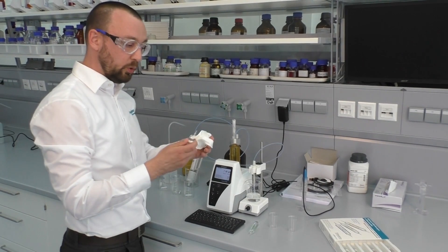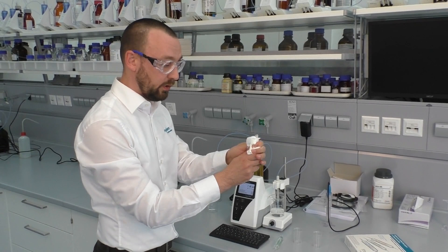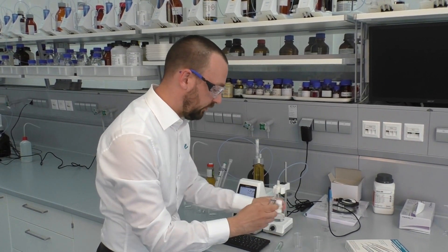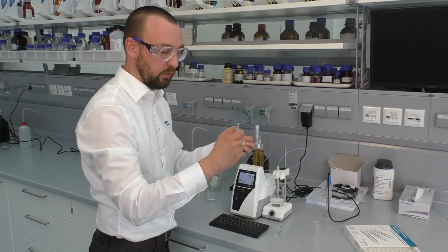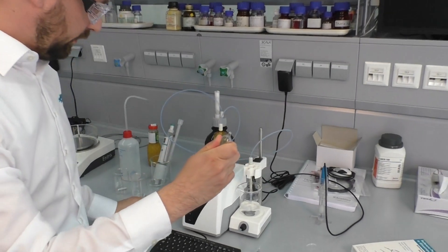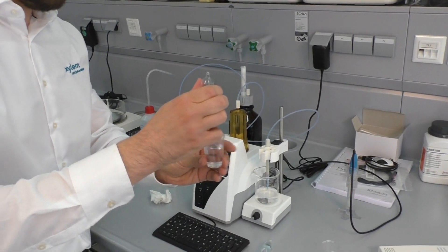To open the buffer solutions we are breaking the necks on both sides. First side — then we can pour the solution into the beaker. Then we break the second neck and the buffer solution flows into the beaker.